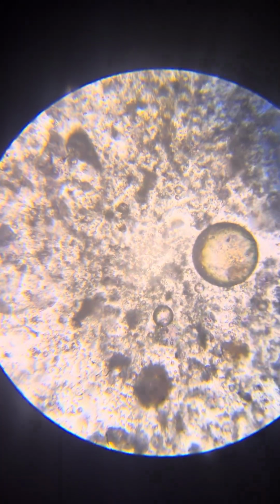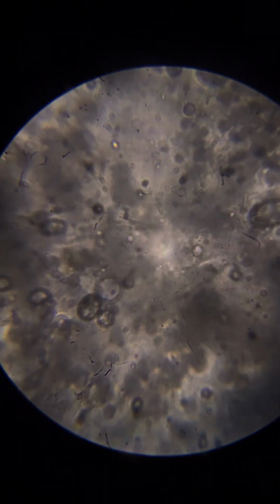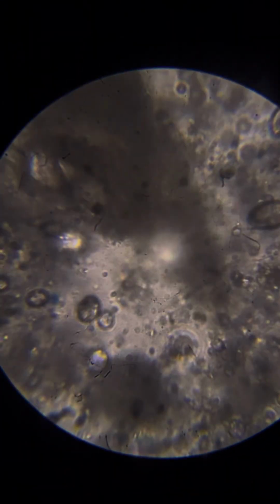Some people want to see flow, but you need to touch the cover in order to create flow, or just to zoom in. Actually, if you zoom in to the maximum, you mostly see flows in fresh slides at the maximum level of zoom that you can use.